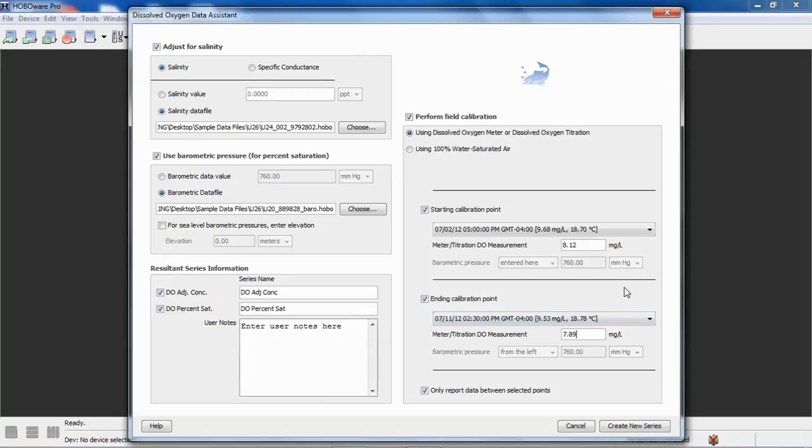Again, we had a meter. We took a sample of the conditions at the time. If you wanted to use the 100% water saturated air using the cap and the sponge with fresh water, you could do that. Keep in mind that you need a barometric pressure value to enter to correlate with this same time. Again, you can do that with a meter if you have one on hand, or from the left selection, it's going to take that barometric pressure data from whatever you selected over here. So if you put in a single value, it will use that. If you're using a barometric pressure data file, it will use that.